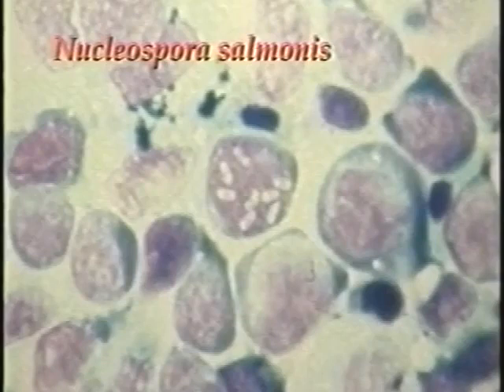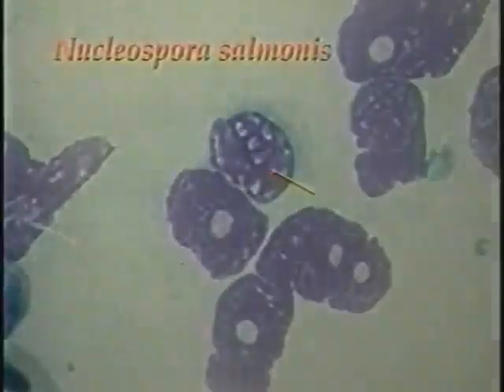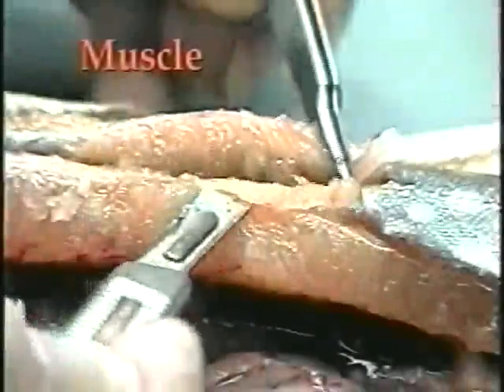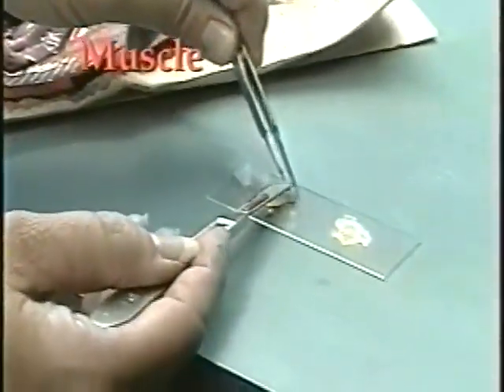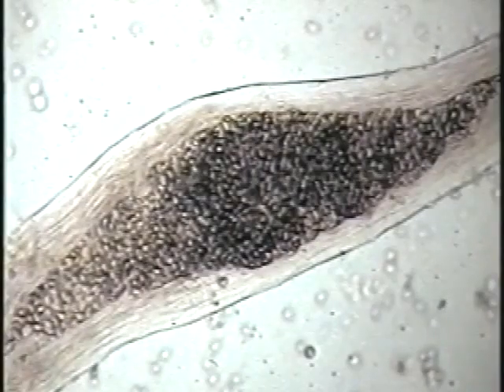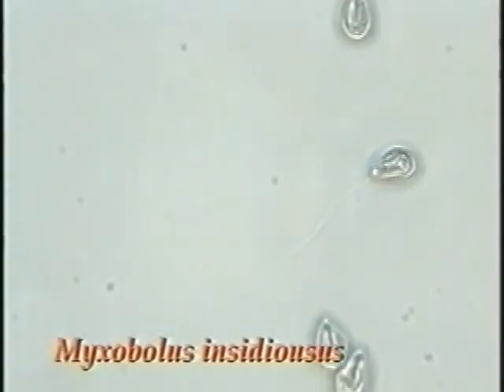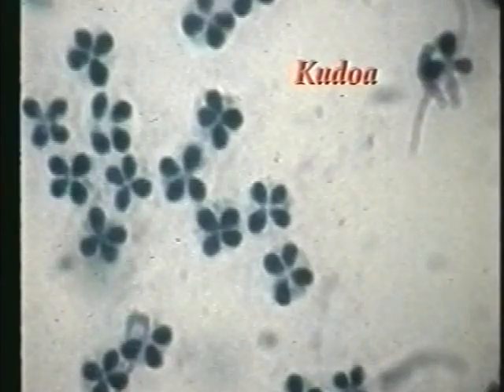Another parasite that can be detected in imprints from the kidney or spleen is the microsporidian Nucleospora salmonis. This organism will be evident as an oval spore in the nuclei of developing blood cells. Thin slices of muscle can be cut and examined either by placing the muscle on a slide and holding up to a light source to detect parasite cysts, or by squashing the tissue and examining microscopically. The myxozoan parasites Myxobolus insidiosus and species of Kudoa can be detected in this manner.